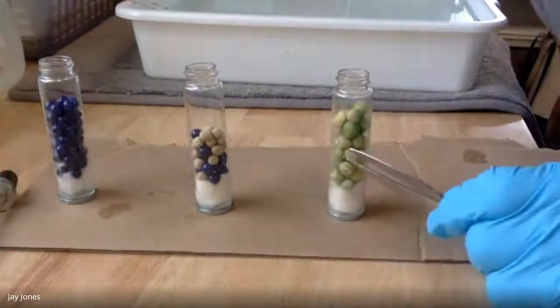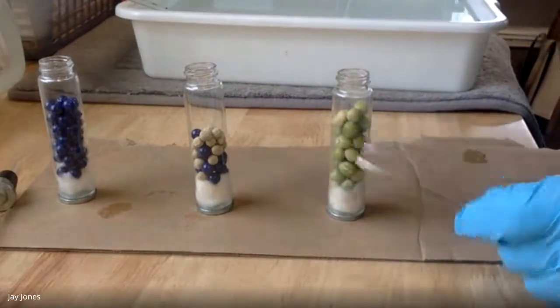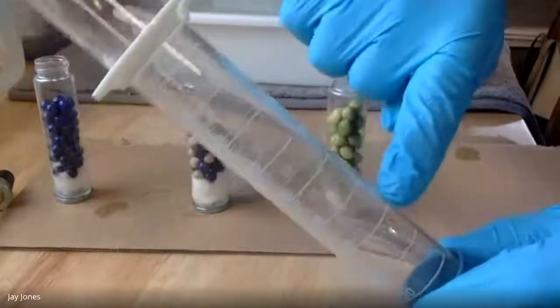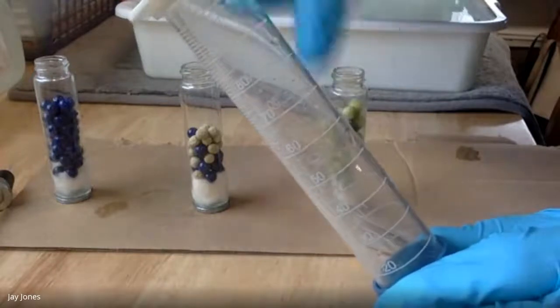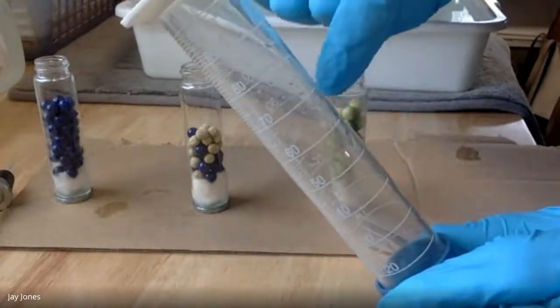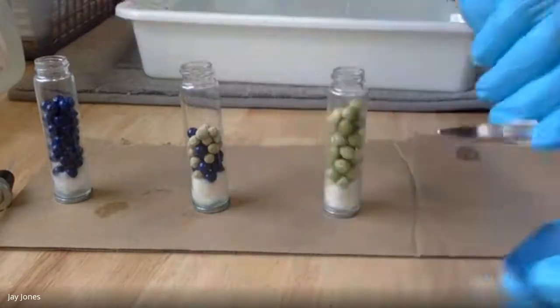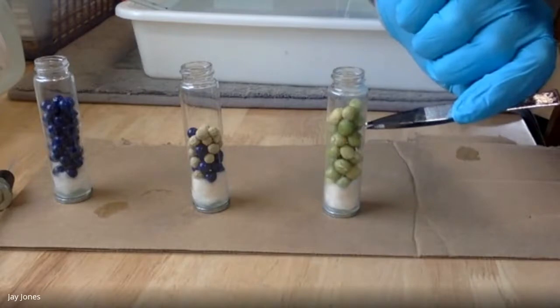So now you see germinating peas with this one. There's actually 25 exact peas here. I took those peas and put them in this graduated cylinder. I did it this morning and I filled it to 50 mLs. Then I dropped them in, one by one, and the water went to 60 mLs. So that tells me that the volume of these peas is 10 mLs. I did it by displacement.